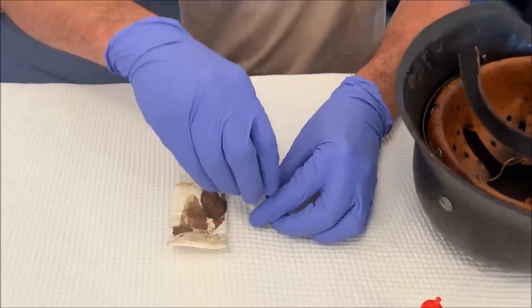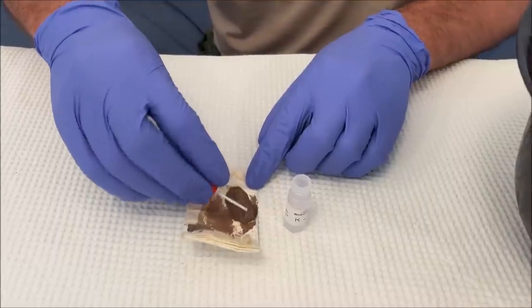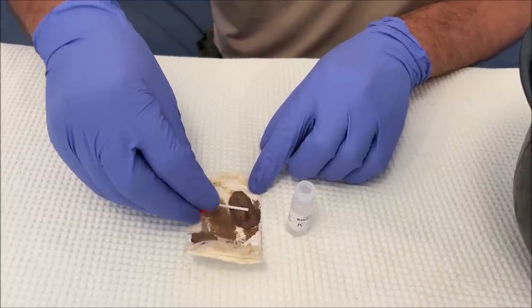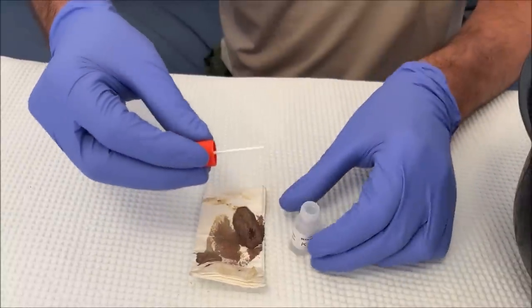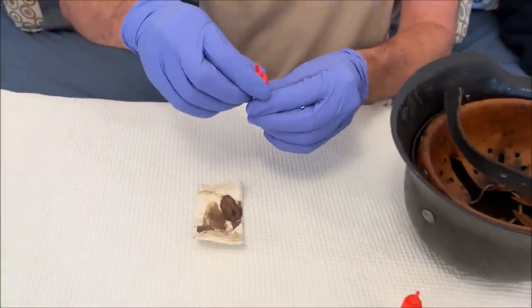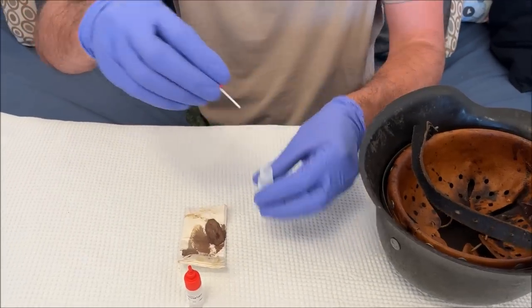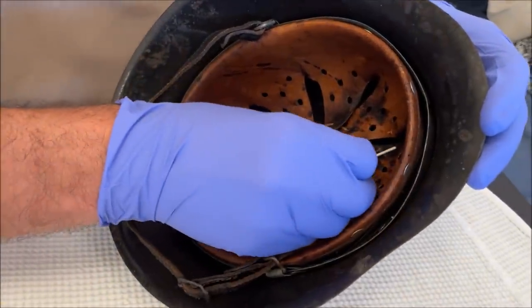According to the guide, you're supposed to rub the blood. I'm really not sure this is going to work well with old hardened blood, but let's try. That's for the kleenex, and now for the helmet I'm going to be a bit more gentle. We'll go over here where there's the biggest stain and just rub it a bit.